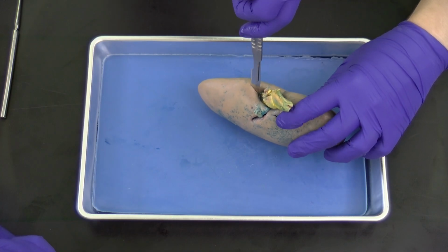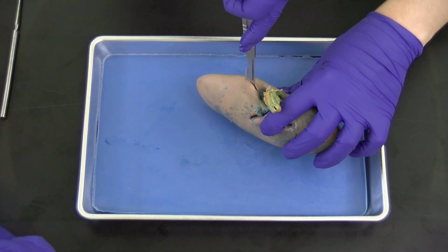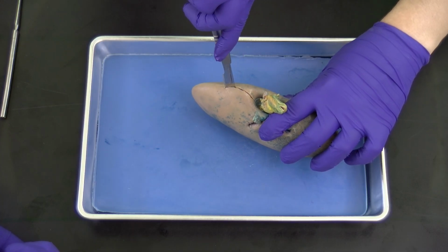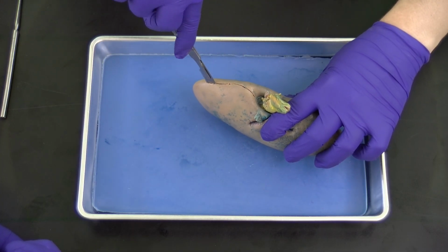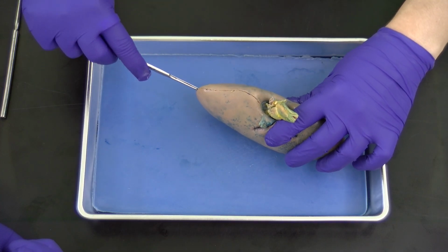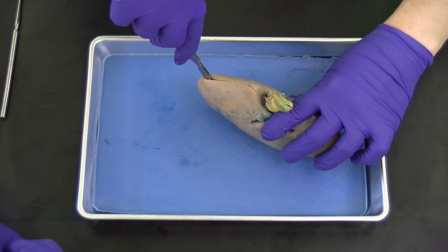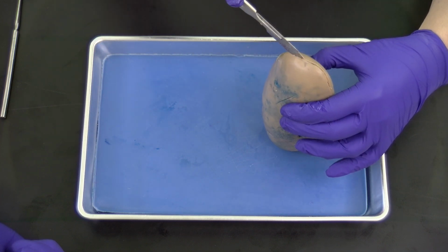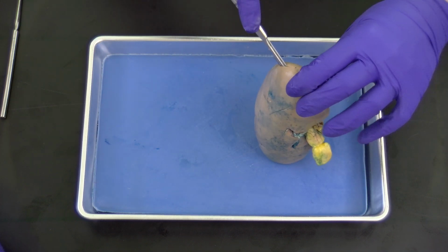So you're going to see, if you're still watching, and we haven't cut this part, you're going to notice, friends, that as we make this dissection, it's rather difficult because, again, this capsule is indeed really very strong to protect the interior of the kidney and where we have all of our functional units.